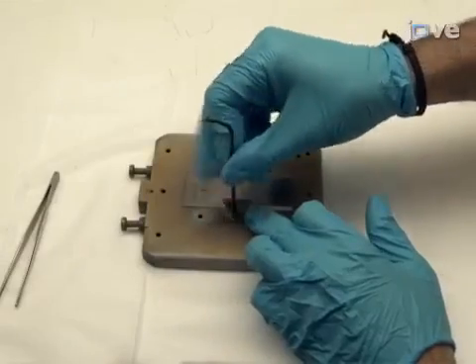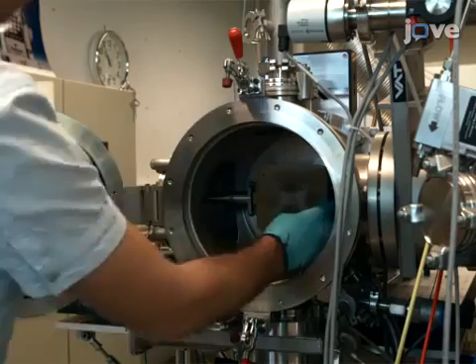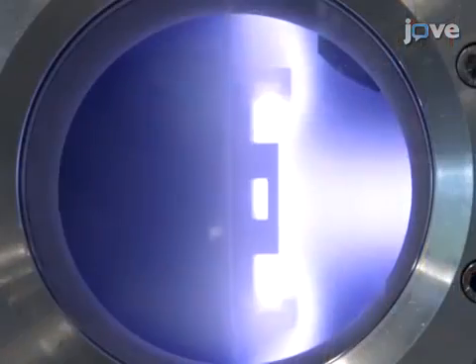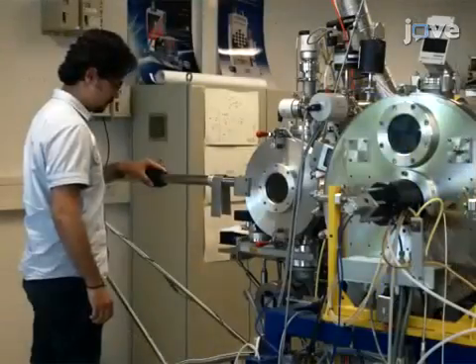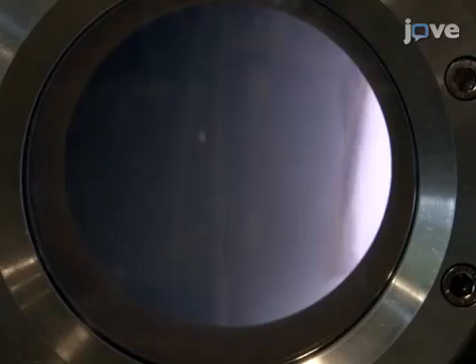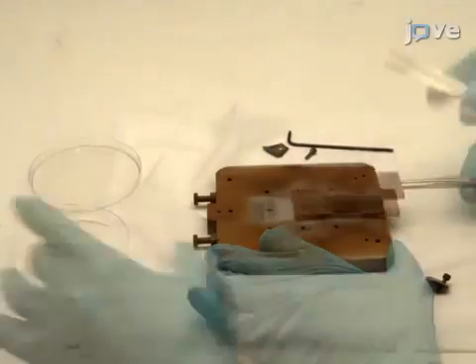Begin by synthesizing nanocrystals of interest. Deposit the silicon nanocrystals onto a glass substrate using plasma-enhanced chemical vapor deposition. Here, silicon nanocrystals are synthesized with an approximate size of 2 to 120 nanometers and a bimodal distribution in the ranges of 2 to 10 nanometers and 40 to 120 nanometers.